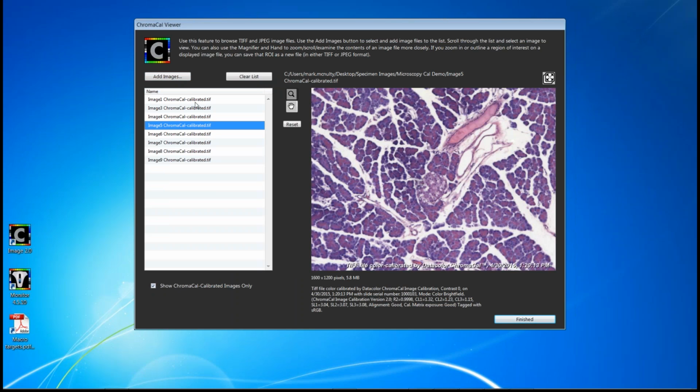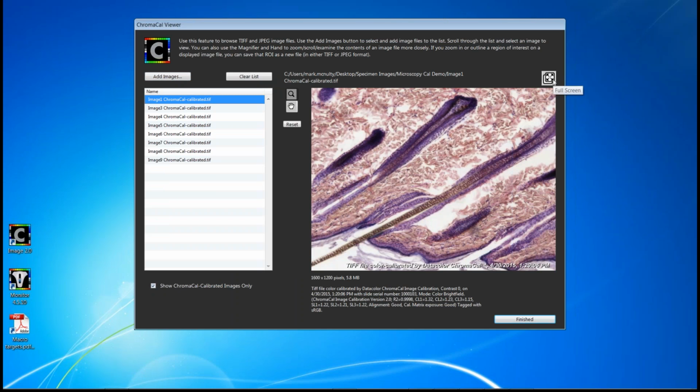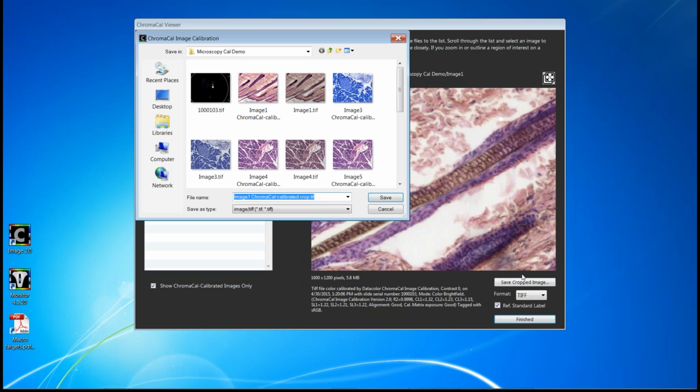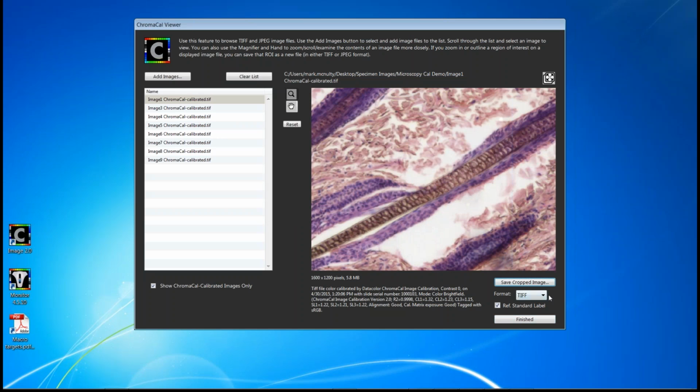When you select an image, you have the ability to look at it full screen like before, zoom in, any of those same things that we looked at on single image calibration. But at this point, you're not calibrating anything, you're viewing it. Now, we did add recently an additional feature here that if you do look at a region of interest, and you want to save that region of interest, you can save the cropped image right here. And again, you can save it in TIFF or JPEG format. So a lot of flexibility even in viewing to save various additions or regions of interest within a given specimen image.